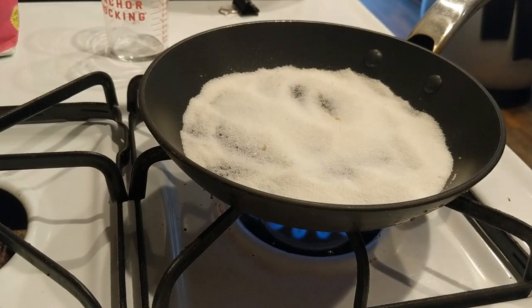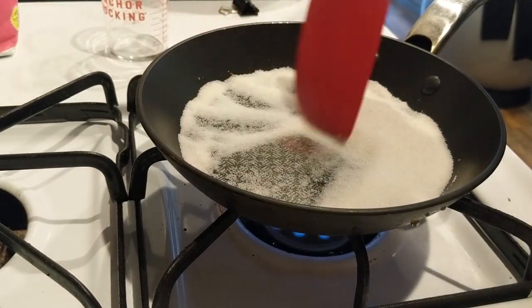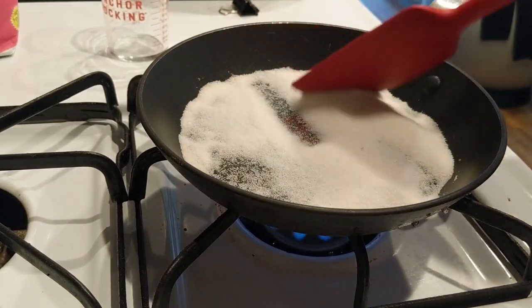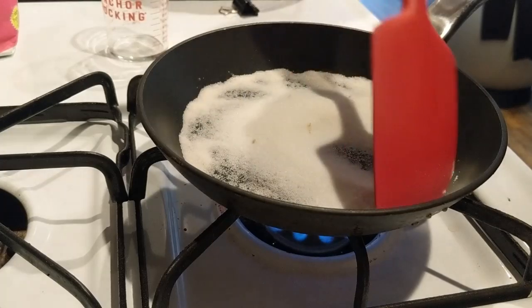All right, we're coming up to 2 minutes. Not seeing much, if any, melting going on.